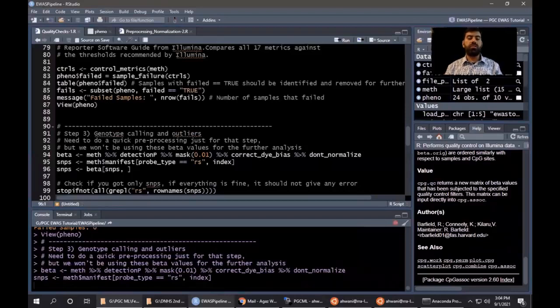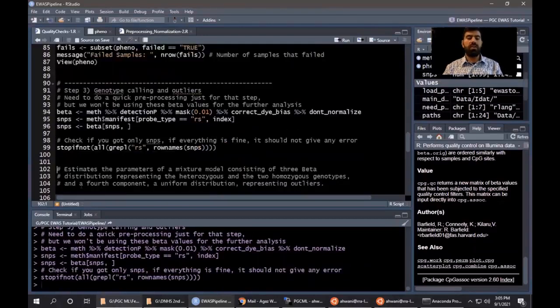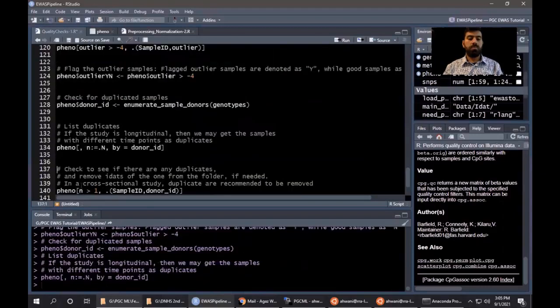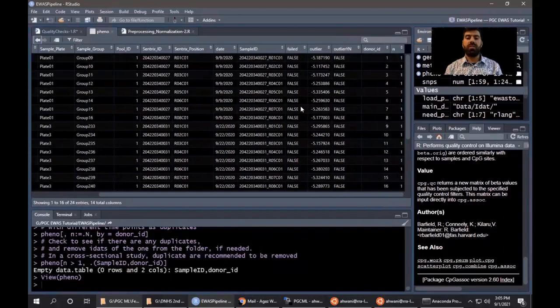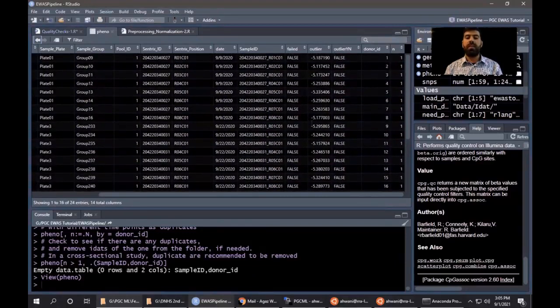Now we need to do the genotype check that will help us to find the mislabeled or contaminated samples. So it will give an outlier score. If the outlier score is greater than -4, it is recommended to remove that sample. So we have the information here. We have written it to the file where we have the outlier information. If it's greater than -4, it's recommended to remove the sample or flag the sample so that you can track it in the downstream analysis.